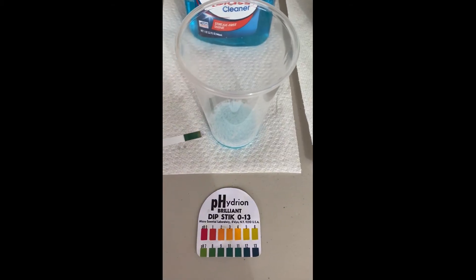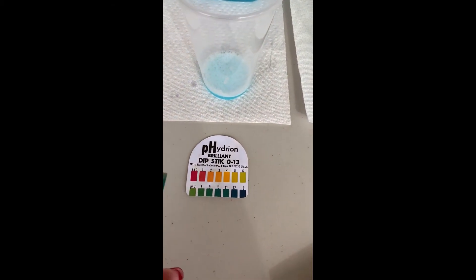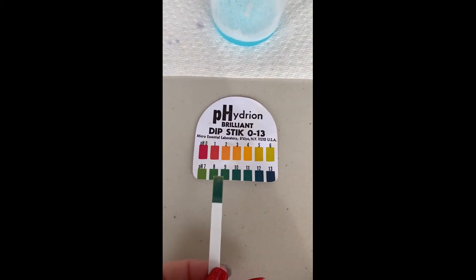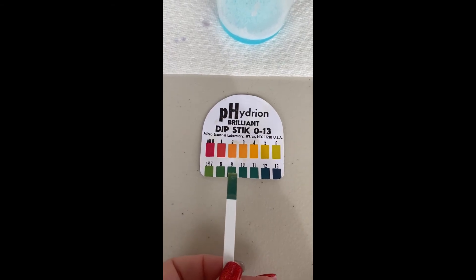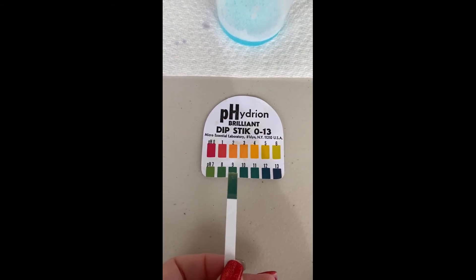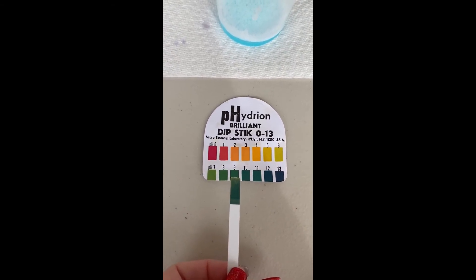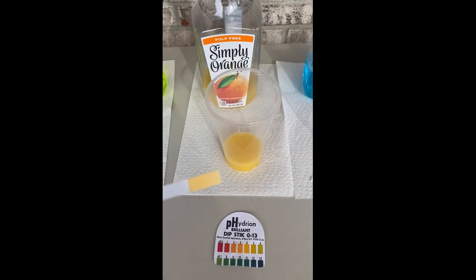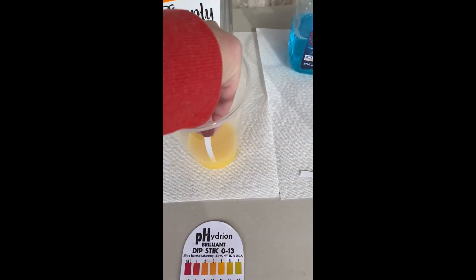So here we have our glass cleaner. Glass cleaner is instantly this beautiful green color, and you can see that it's somewhere between an 8 and 9, maybe even going into 10 as it sits there and gets a little deeper in color.